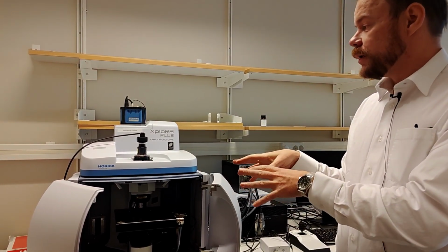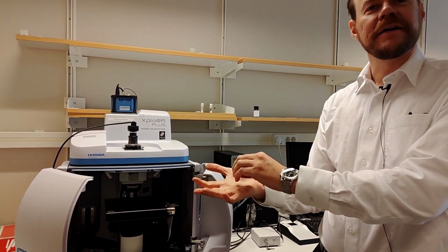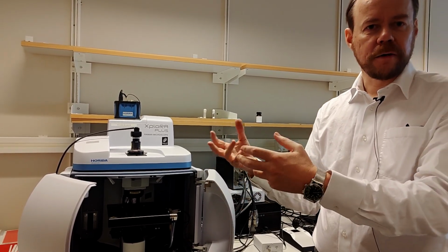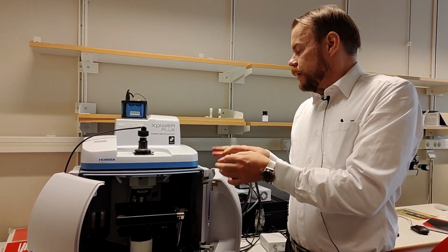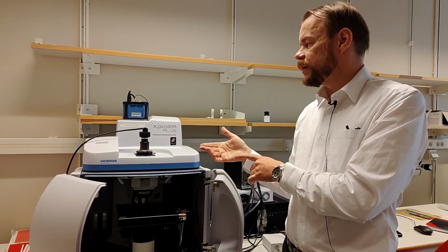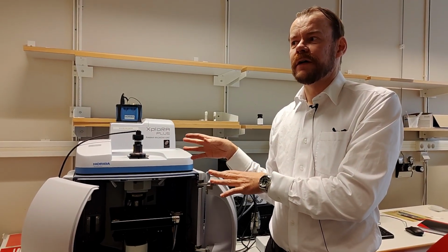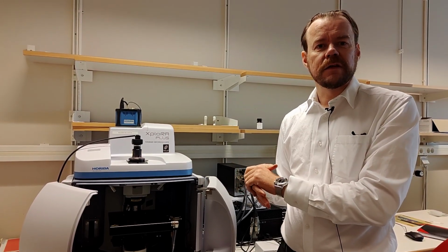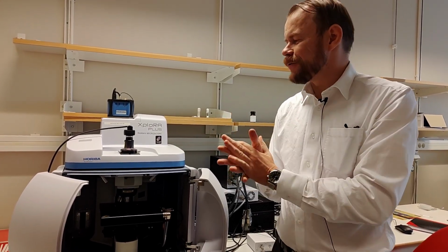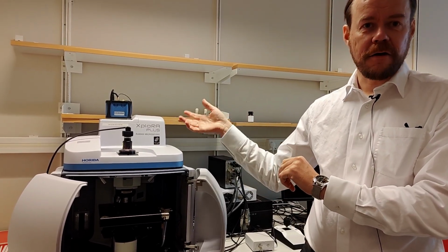Since it is an optical method, the volume you acquire information from in your sample is similar to the size of the laser spot, which is about 1 micrometer in this case. You can use different types of lasers. This machine is outfitted with a green laser. A green laser is usually something you want if you're working with non-organic materials and things like that. And if you're going for more organic stuff, then you probably would like to have a red laser or even up to IR.